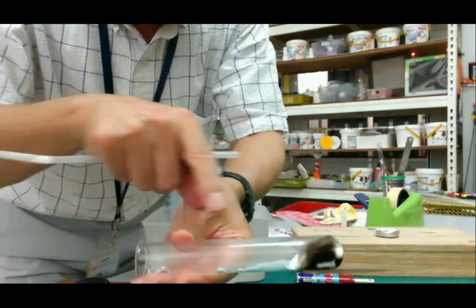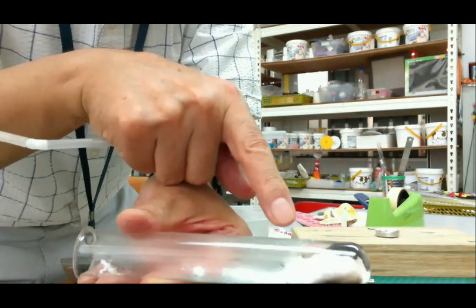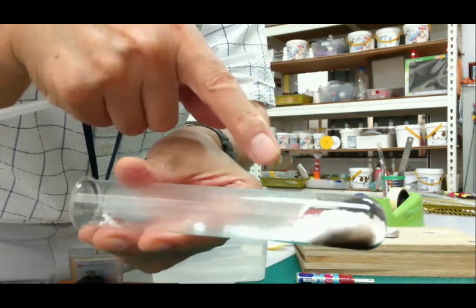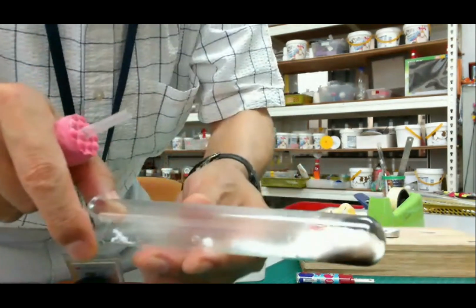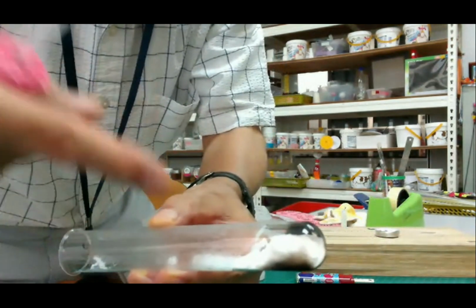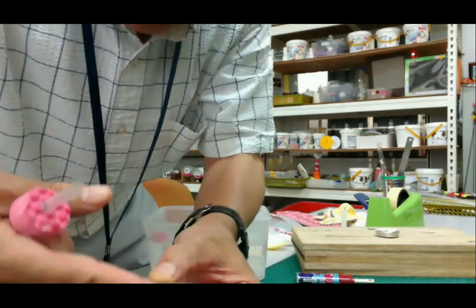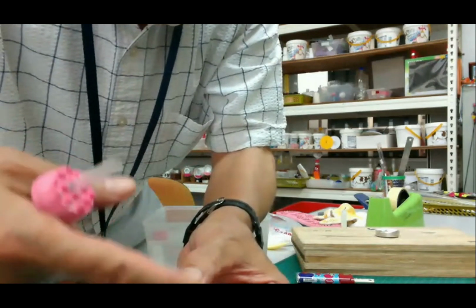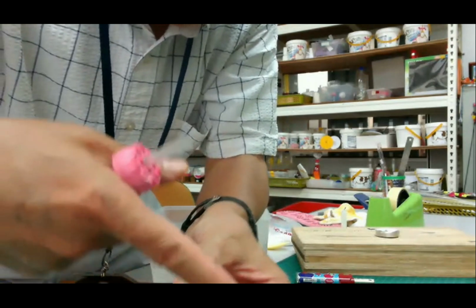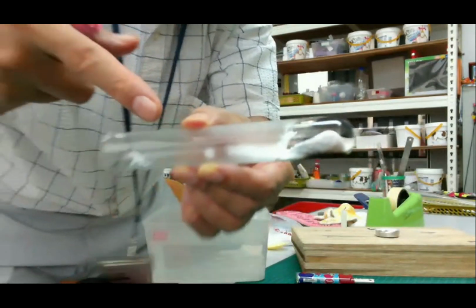Then one more thing. After heating, can you see? After heating, this is the white one. This is sodium carbonate, a white powder. Okay, this is sodium carbonate, and you can see the small water around here. So this baking soda produces carbon dioxide and water. Around here, some water is stuck on the inside of the test tube. Can you see?